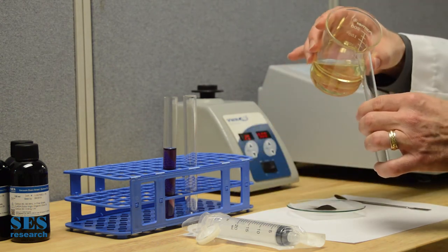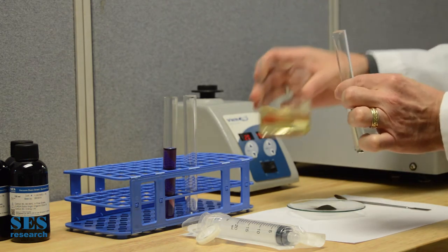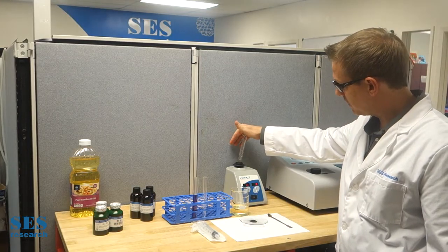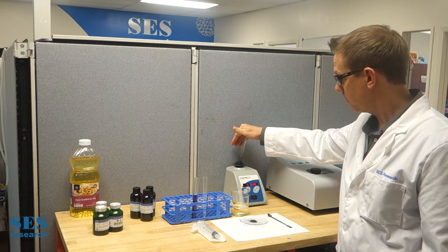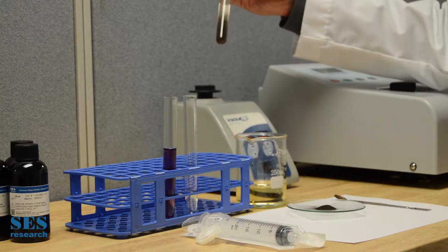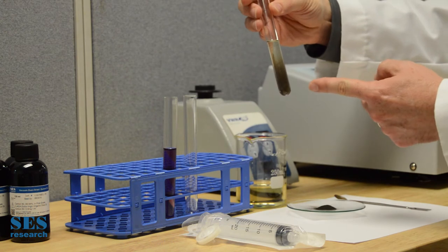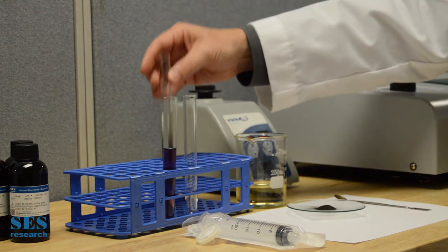We'll put a little bit of C60 in here and pour some sunflower seed oil in here. And we're going to use this vortex mixer. This is good for just mixing. One of the nice things is it doesn't sonicate the actual material. You want to make sure if you're mixing C60 that you don't sonicate it if you're trying to get C60 to dissolve. You can see that it just gets a suspension at this point — it takes about two weeks for it to actually dissolve.